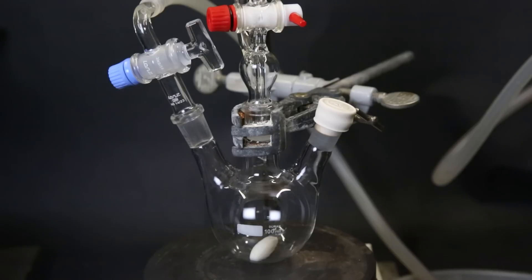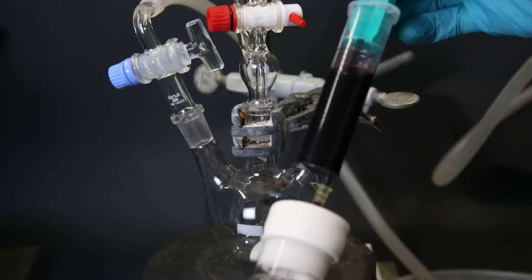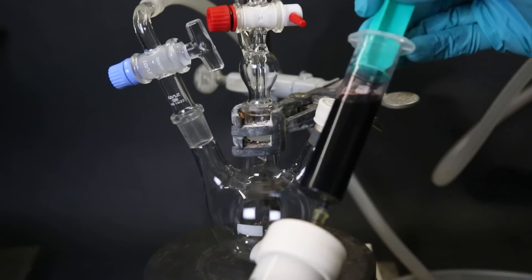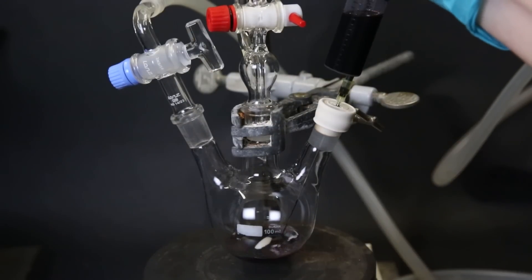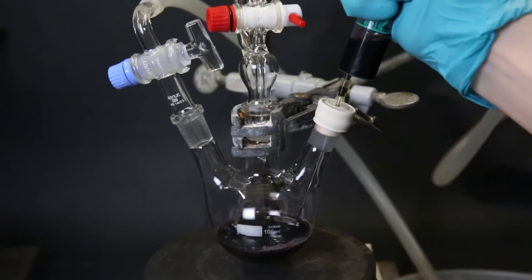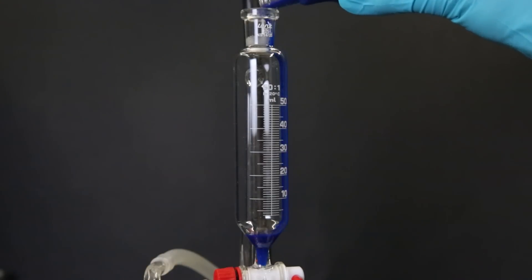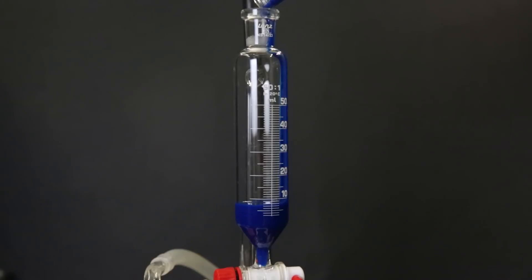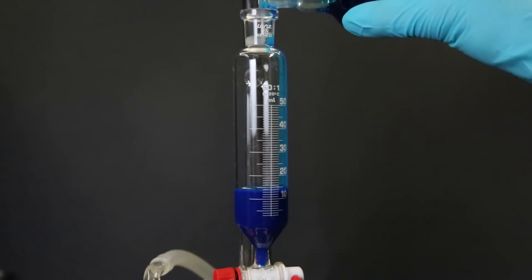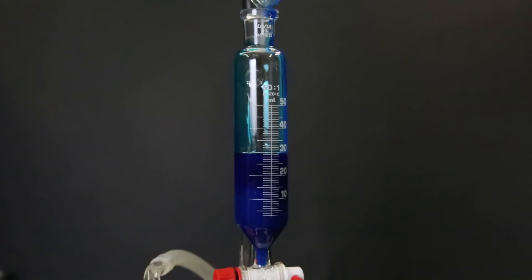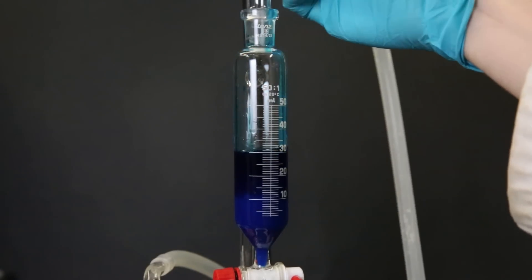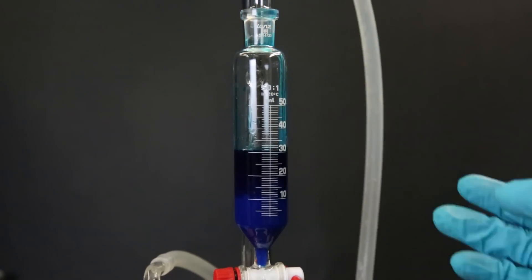Now that the preparation is finished, I can start the reaction. I use the same setup as the ferrocene synthesis and flush the whole apparatus with argon. I then use a syringe to take up about 25 mls of the sodium cyclopentadienide solution and inject it into the flask. Then to the dropping funnel, under argon overpressure, I simply pour in all of the cobalt(II) chloride solution and wash it once with some more DMSO. I then attach the upper part to a gas washing bottle to seal the whole apparatus.